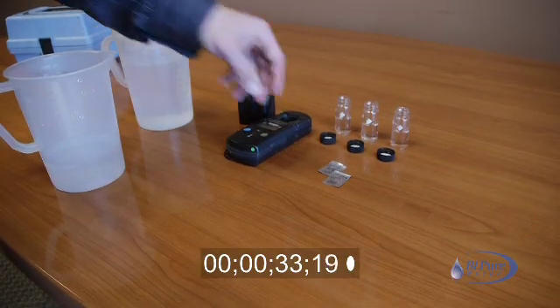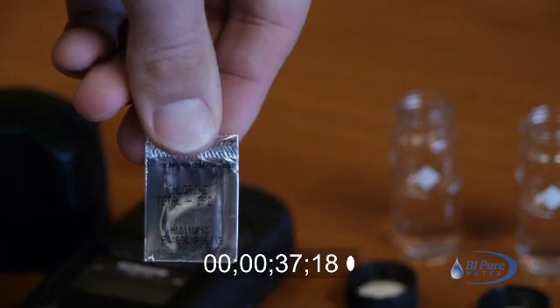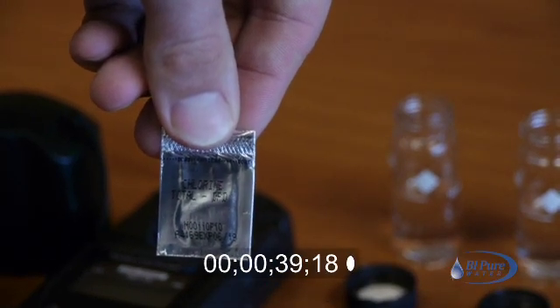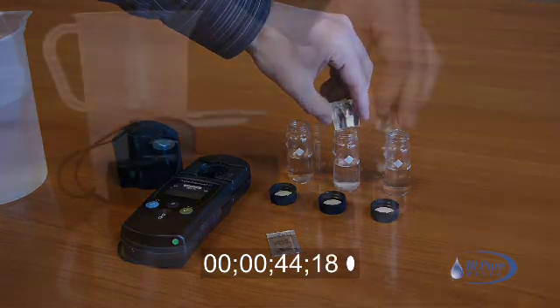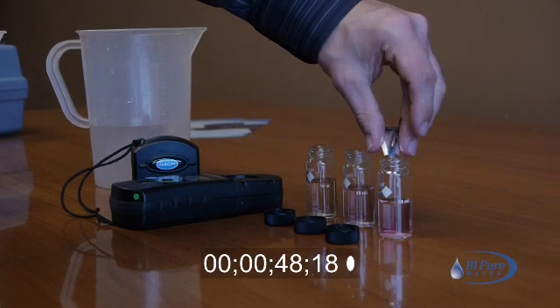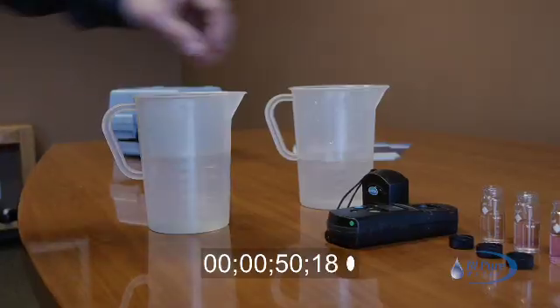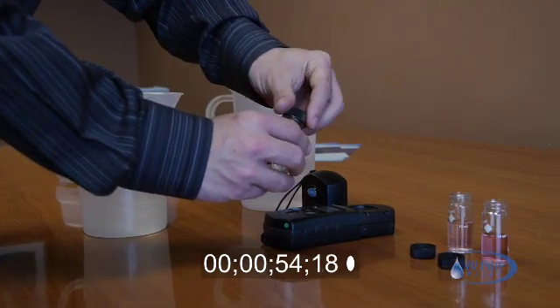Once all three cuvettes are rinsed and filled to the line, put the total reagent pouch in one cuvette. Put the free reagent pouch in the second cuvette. Do not put reagent in the third cuvette, as it will serve as your reference cuvette.